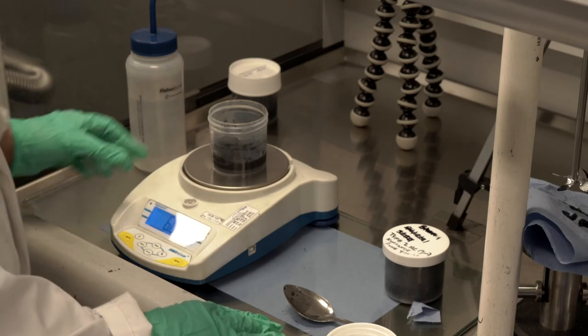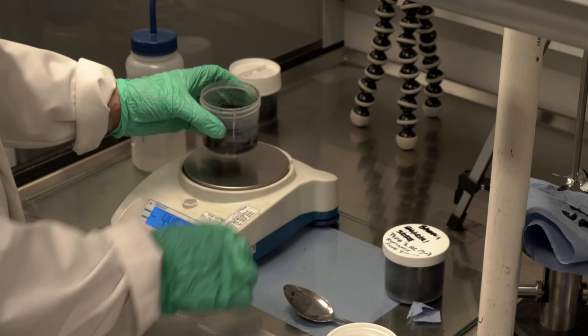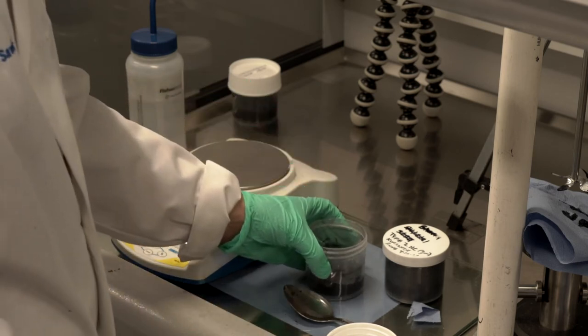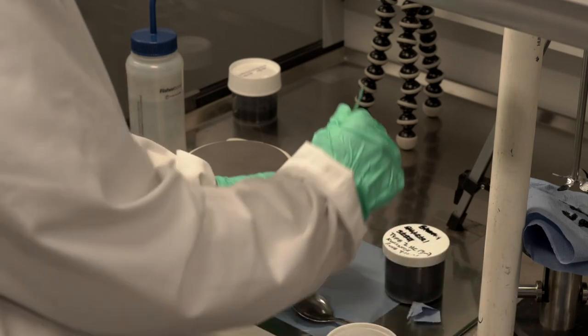Once again, for the same reasons as with the carbon black, I'm going to need to hand stir that before I put it in the mixer to avoid loss of that dry material.